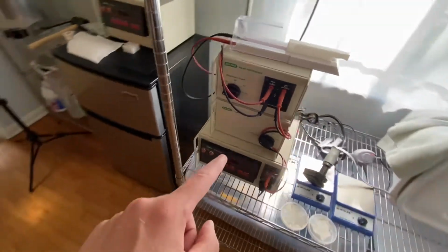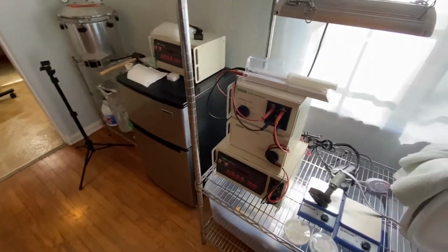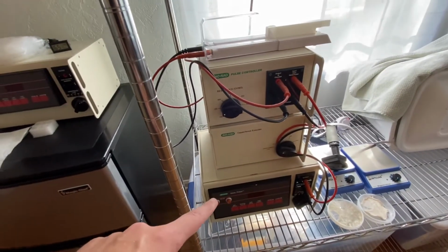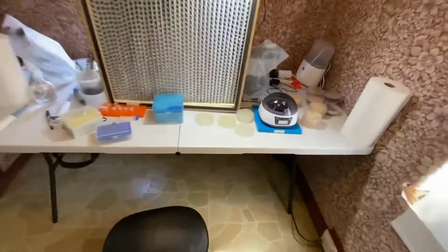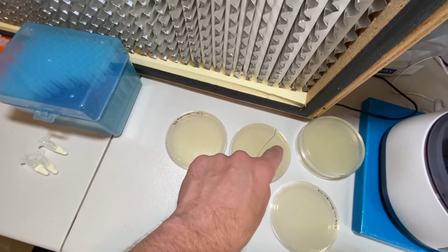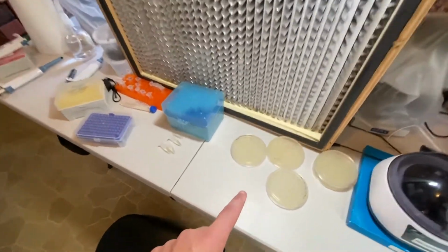But I think one of the things that I should be trying is to use a higher voltage setting. And so this one calls for 2.5 kilovolts. And I'll admit, I'm a little concerned that if I crank it up that high, I'm going to start getting a lot more arcing, which means that I have to do more work to prepare cells. But I have read that for agrobacteria, it's also better to use a higher voltage as well. So that makes sense. One of the other things that I was thinking about with this issue that I'm having with my plates, not showing colonies in the middle and creating colonies around the edges, is one, my spreading technique. And I'll get to how we're going to test that in a moment.